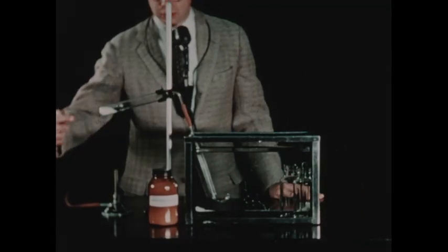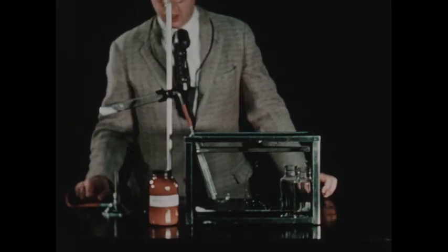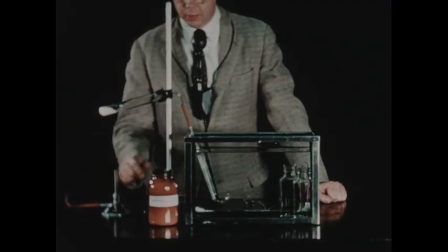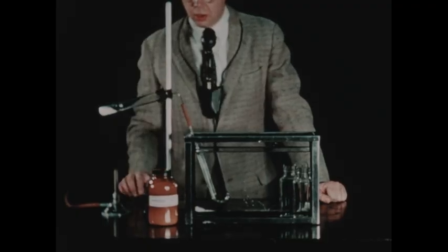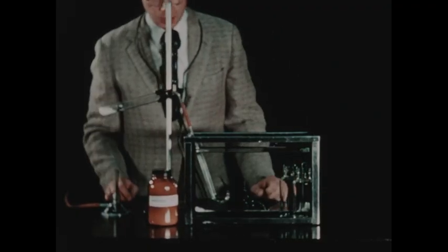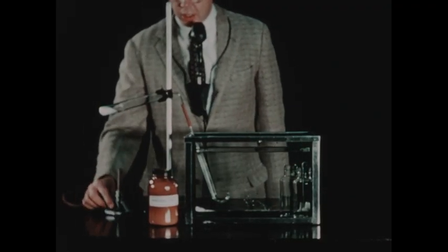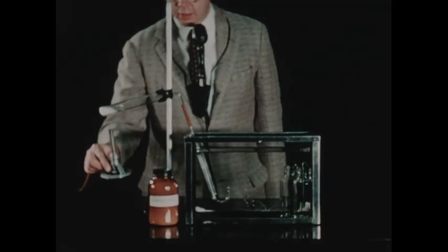In this test tube, we've placed about 15 grams of ammonium nitrate, which, when heated gently, decomposes into nitrous oxide and water.